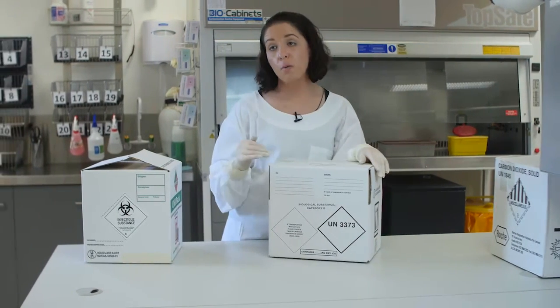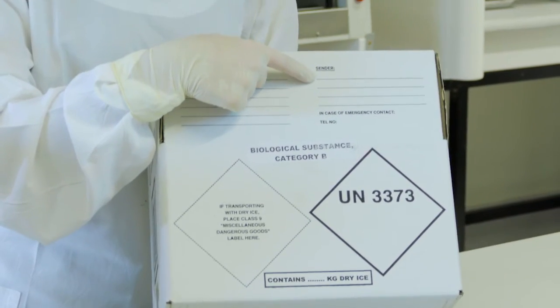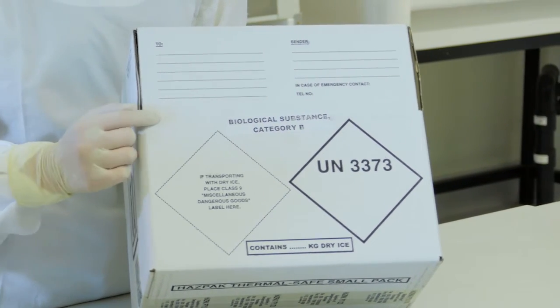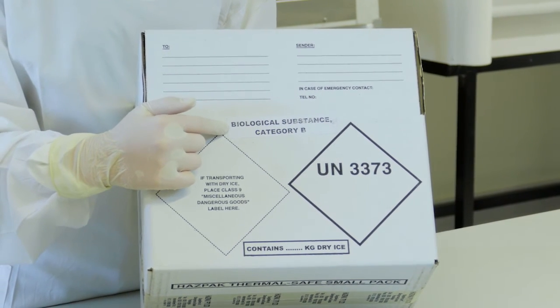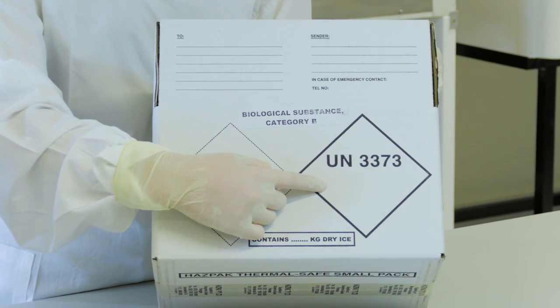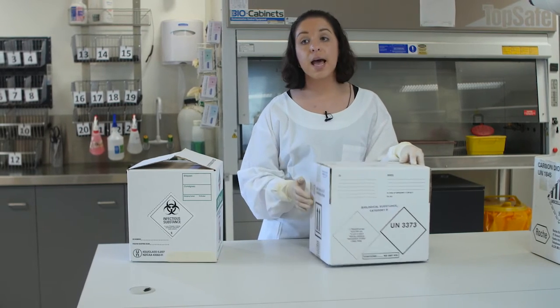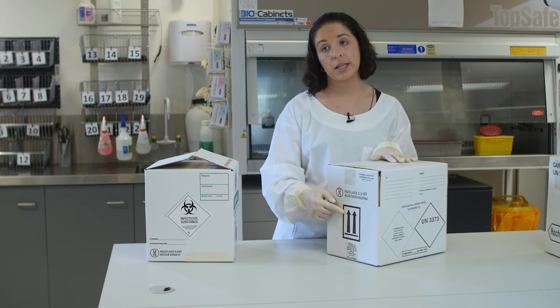What you do need to ensure is on the box includes the sender information and the receiver information, a 24-hour contact name and number. You need to include the words 'Biological Substance Category B' on the box somewhere, and you'll need to ensure that the UN 3373 mark is present. Same as Category A, if the parcel has 50ml or more of liquid in it, you will need to include orientation labels.